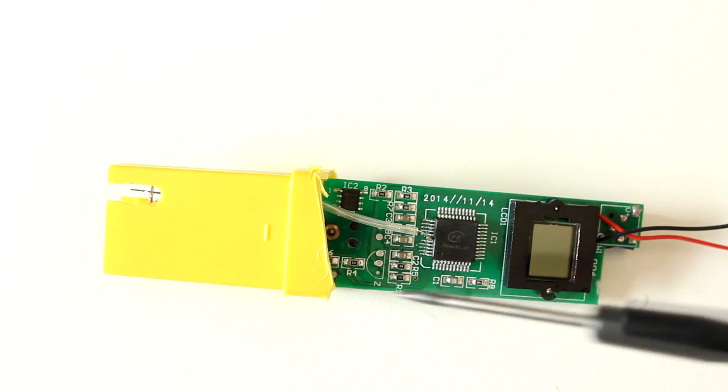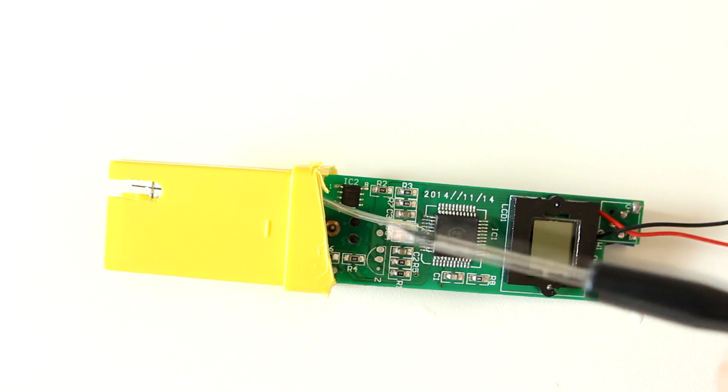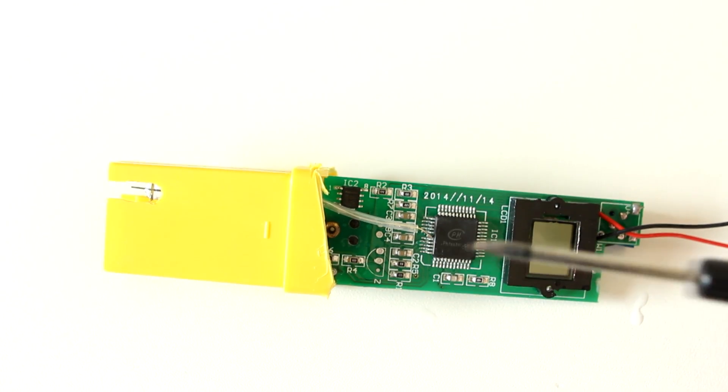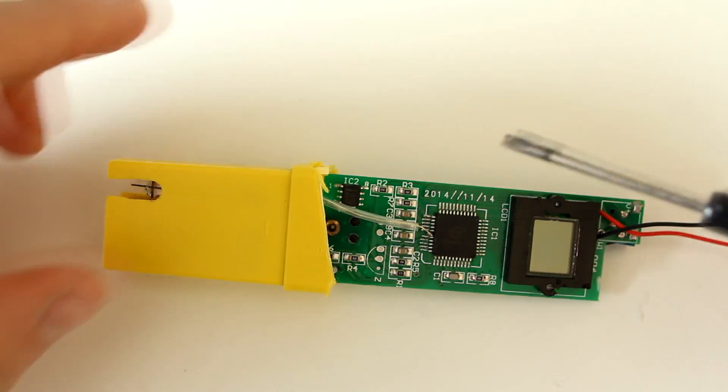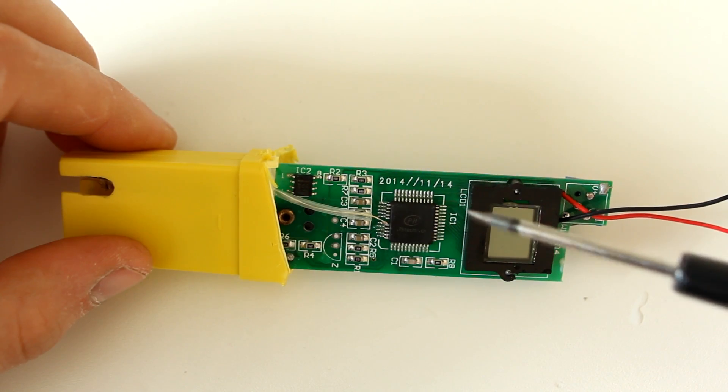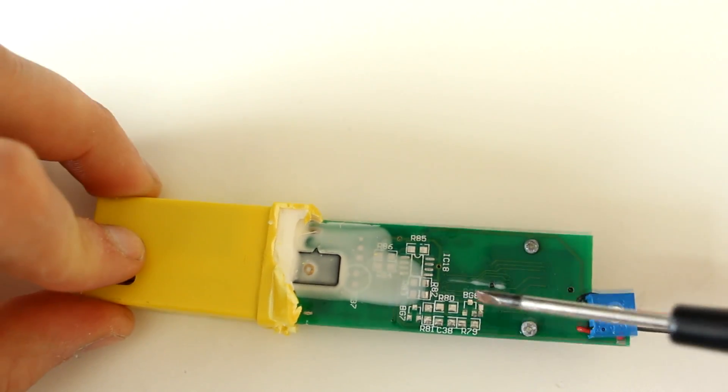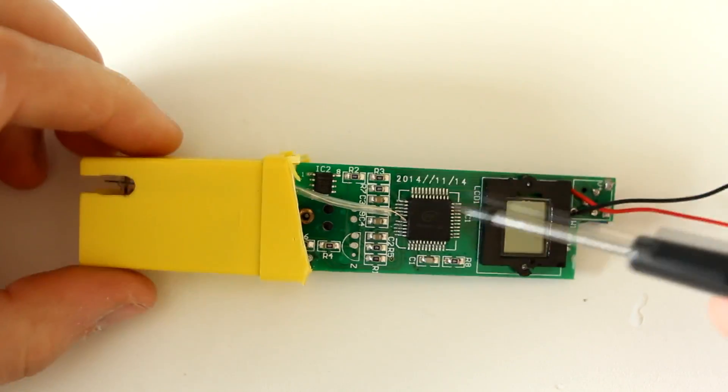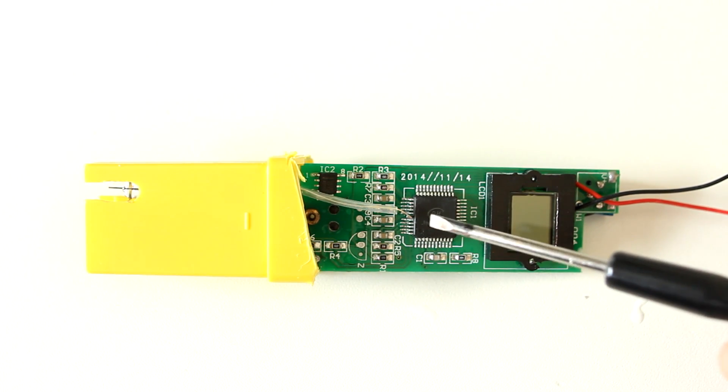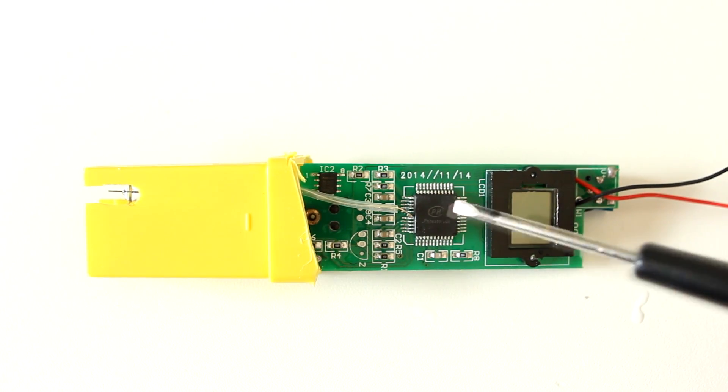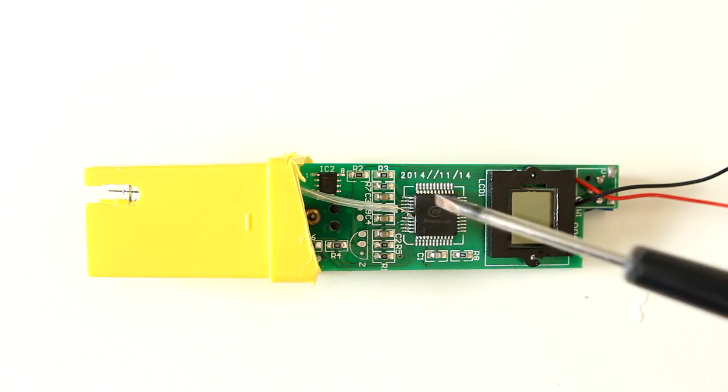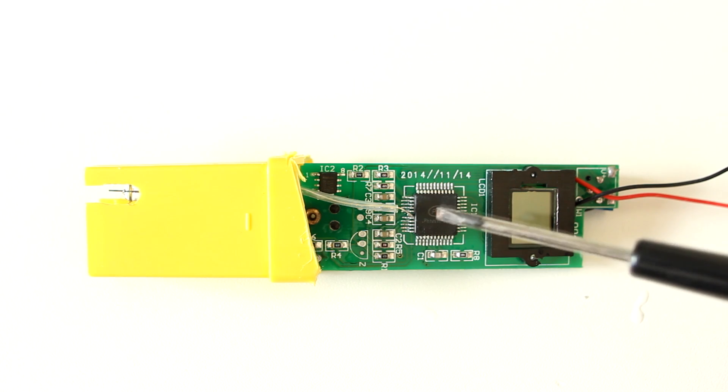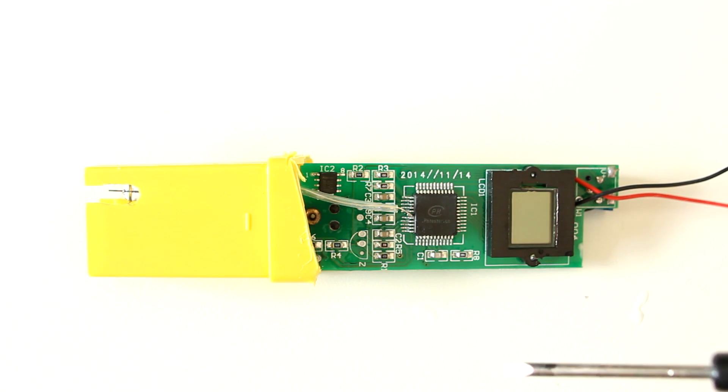So kind of a waste I would say, but it was only a couple of euros, so it's okay. Interesting to see that there's actually a custom pH meter chip, and that it's apparently worth it to just make custom silicon for this. Maybe it's just a microcontroller with a hard-coded program in it, but yeah, that's it - it's a really simple device as you would expect for such a low price.